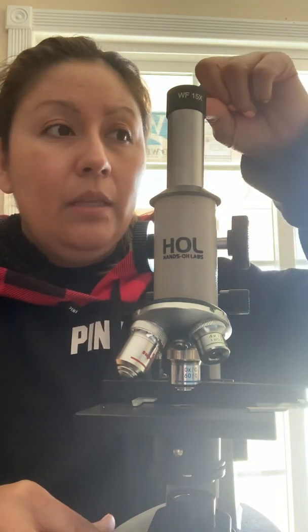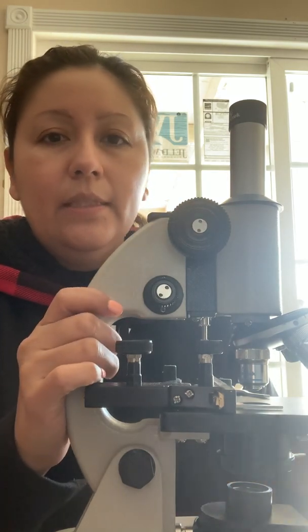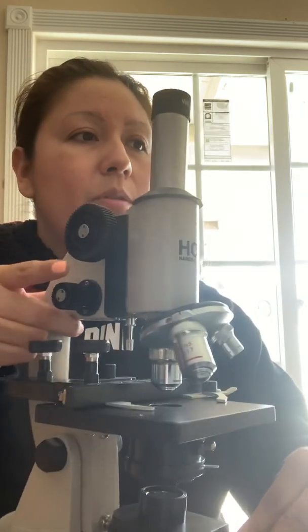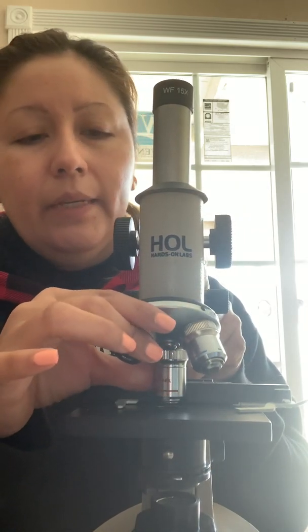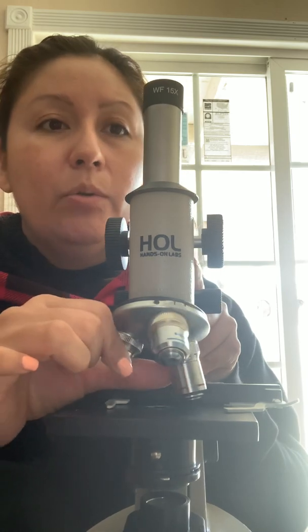This here would be the ocular lens or eyepiece, and this pretty much allows you to view the slide. So this is where you put your eye. The arm is this part over here. This pretty much supports the lens of the microscope, and it connects it to the base of the microscope. The turret is this part here, and that could be switched around. It really lets you choose the proper magnification power that you need depending on which slide that you are seeing.